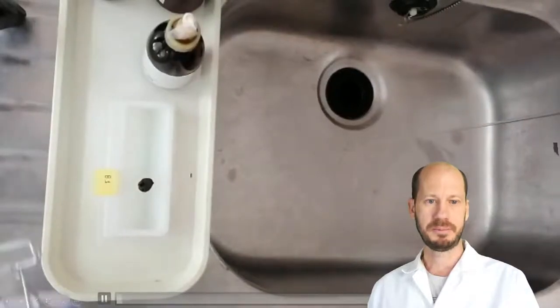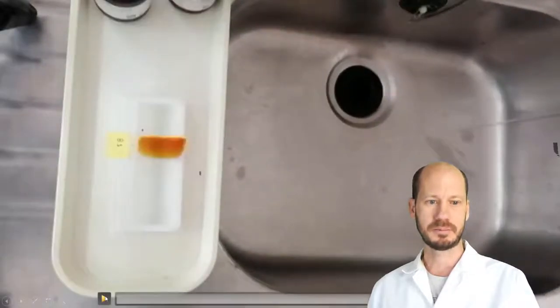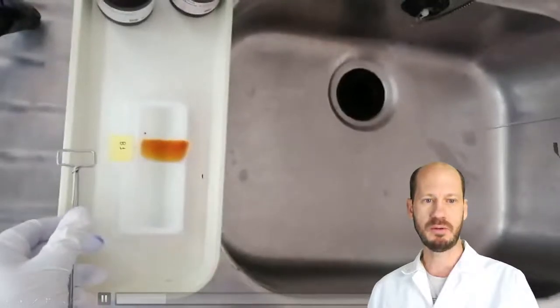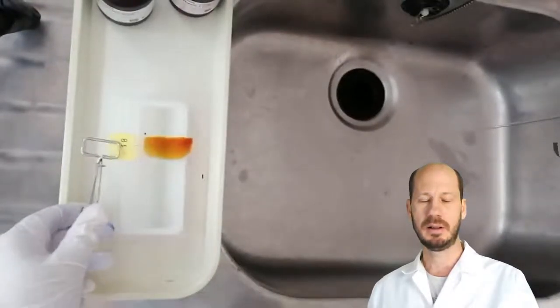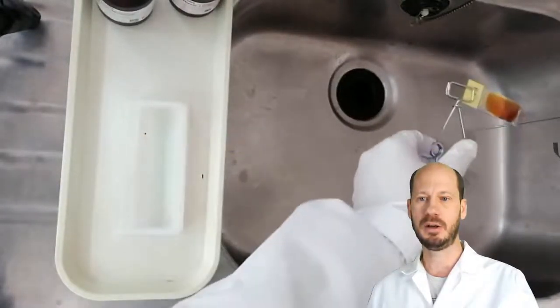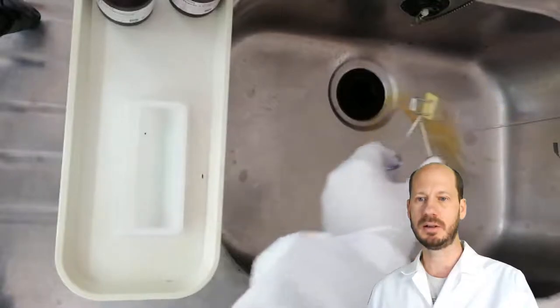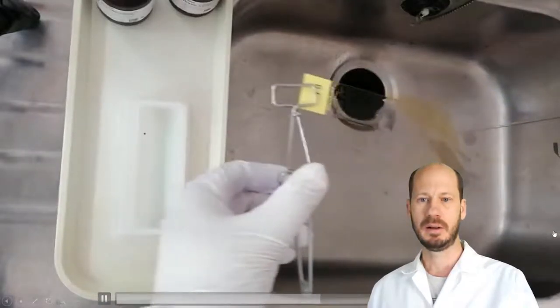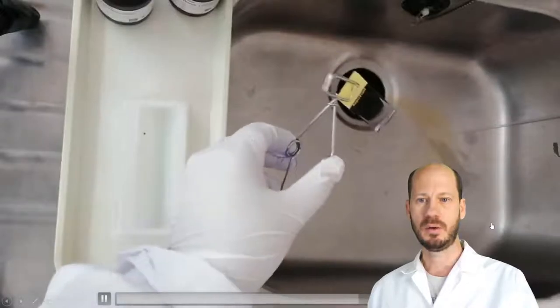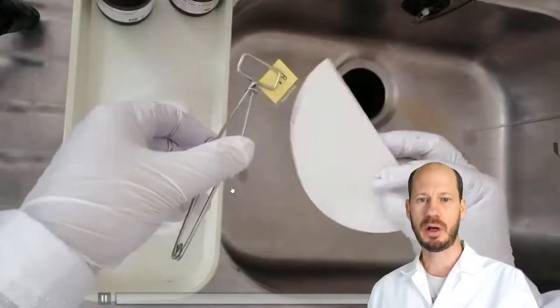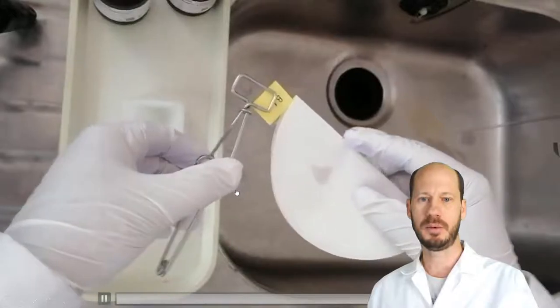Next step. We are going to remove that crystal violet, the iodine from this slide. Just a quick wash. And you can blot dry with a filter paper.